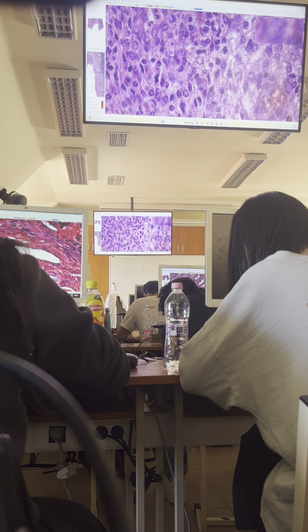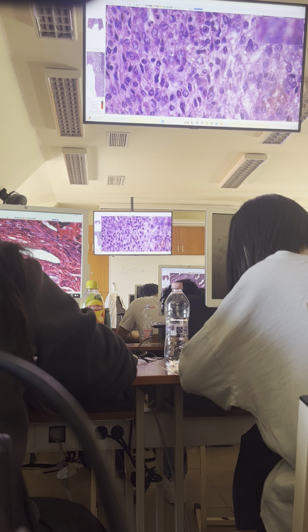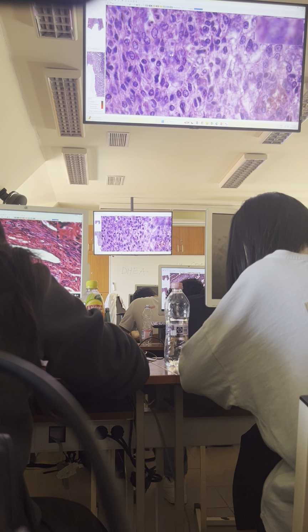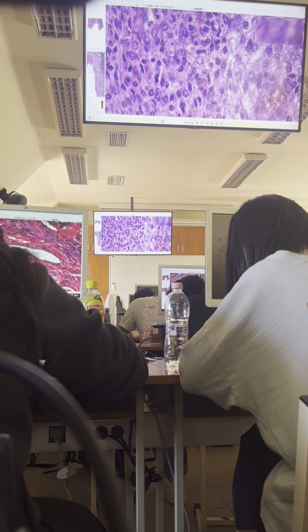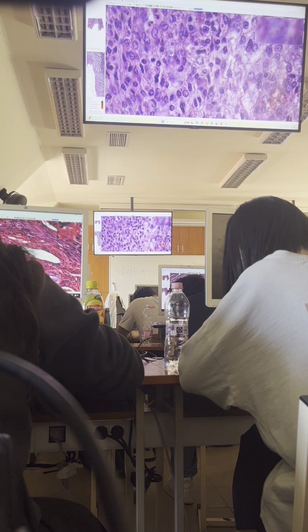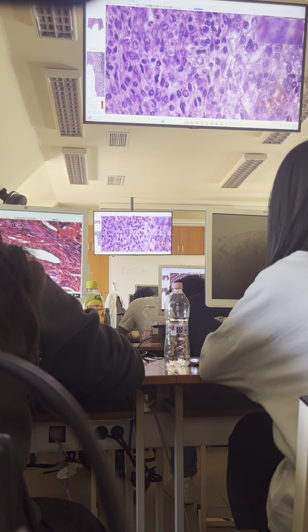And this transformation is due to hormonal changes, due to the increasing progesterone as well. These cells are undergoing a so-called epithelioid transformation, which means that these cells, remember they used to be stromal cells, which means connective tissue cells. And these connective tissue cells are becoming more and more similar to epithelial cells. This is what epithelioid transformation means. They are becoming epithelial-like cells, epithelioid cells.